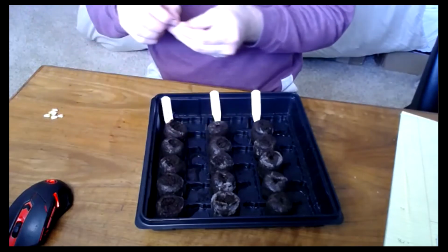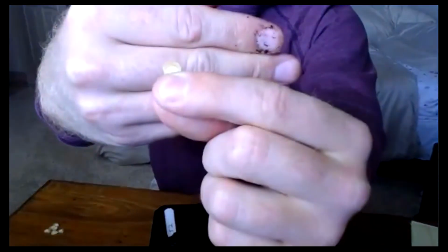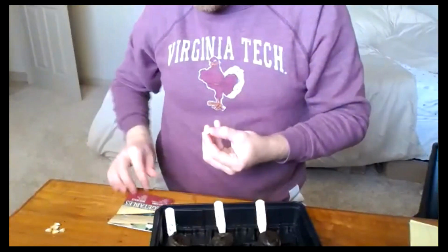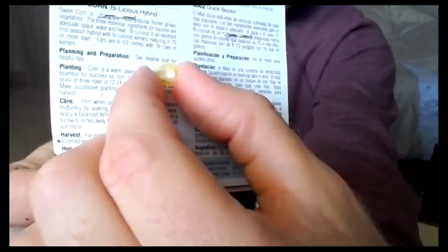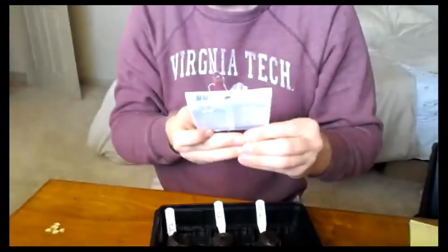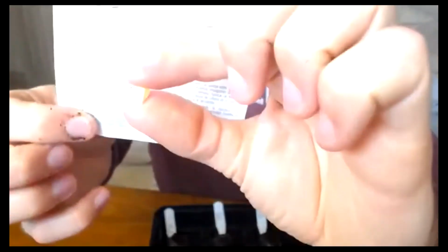I'm going to have, let's see, upright, so setting up, like, best way to show this, like so. Right, the last one was on its side, pointed east. Right, that was treatment 2. Treatment 3 is just flipping it 90 degrees. Like so.